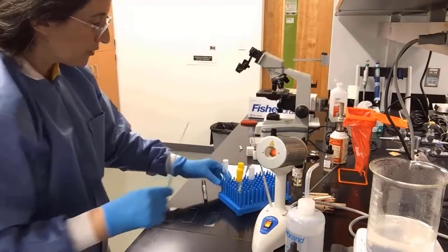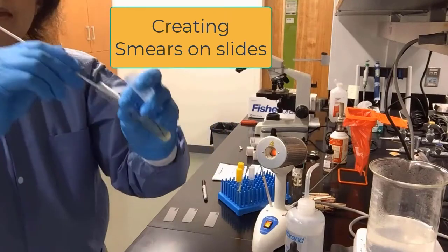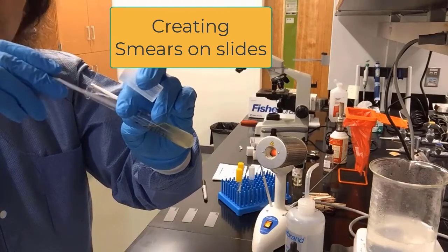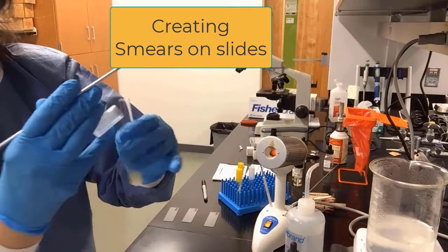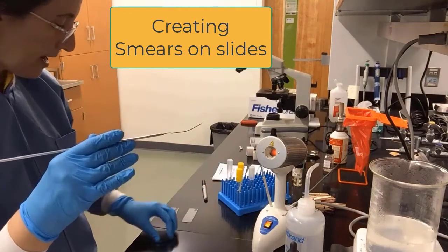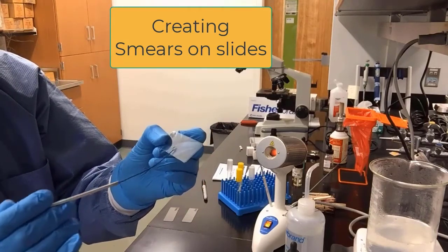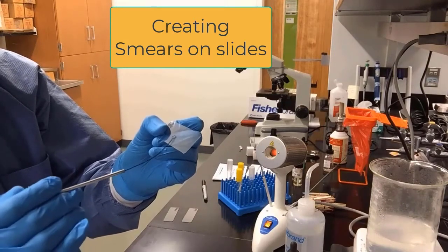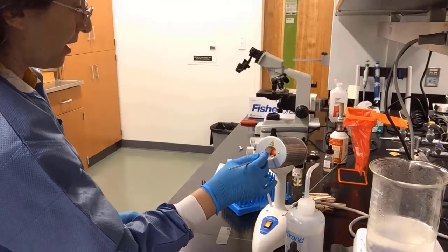We have loops that we have sterilized and cooled. We pick up our E. coli and now we will create smears on slides. We dip our loop into the E. coli culture. We go to the bottom, get a good sample. We don't want to do too concentrated smears because then they will be too thick to stain, and we also don't want cultures that are too old because the staining won't work. So here we're creating a smear on the slide for E. coli, dime shaped to quarter sized. We want to spread the bacterial cells nicely on that slide. We sterilize our loop.